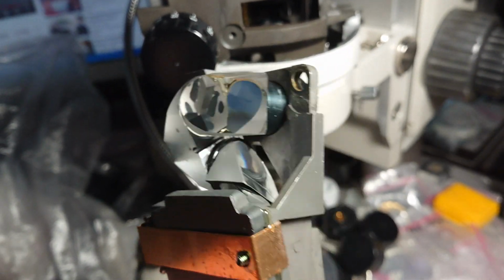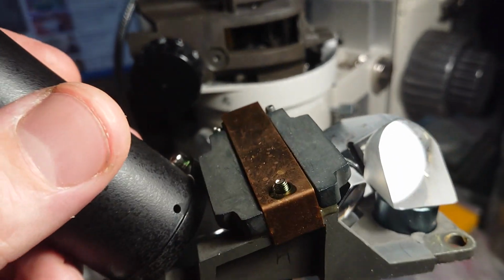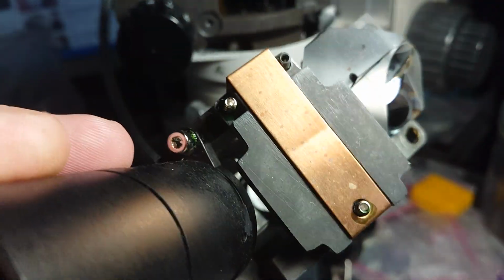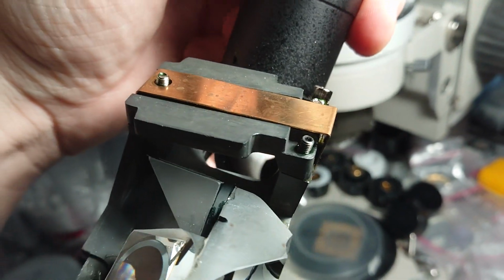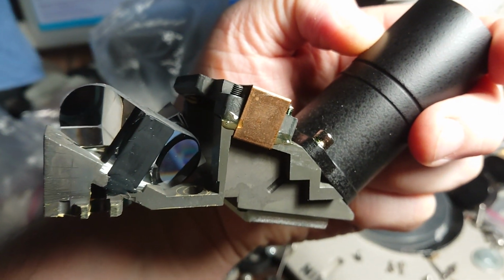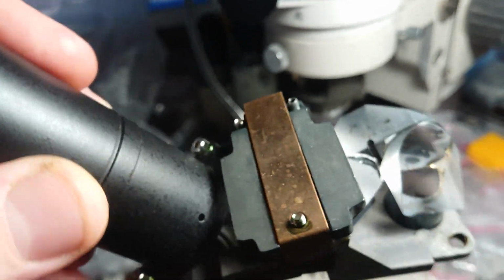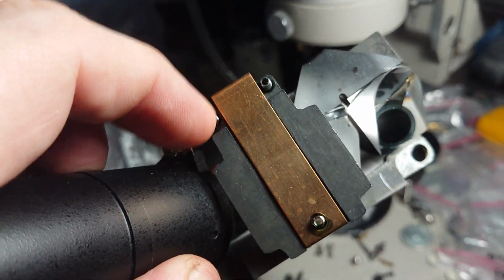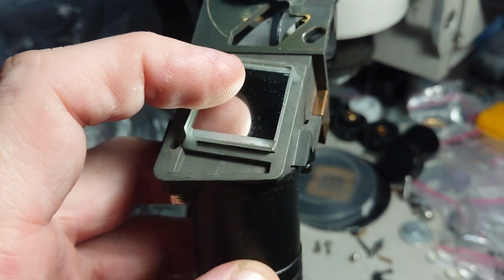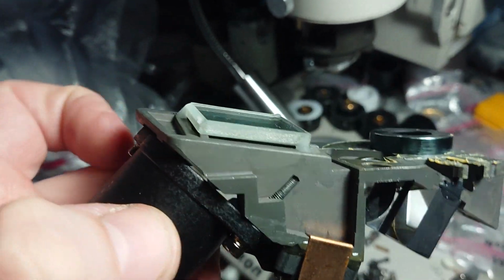Olympus SZ61, but the mirror is made in a bit different manner. We have three micro adjustment screws here, some copper-like springing plate, so we can make some adjustment here. The bottom glass is just glued, no possibility to make corrections.